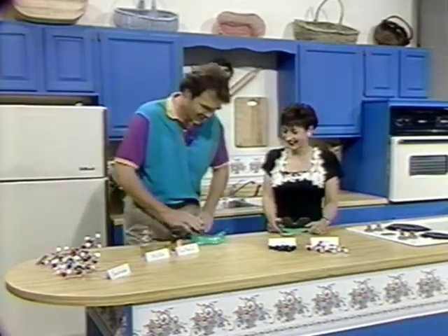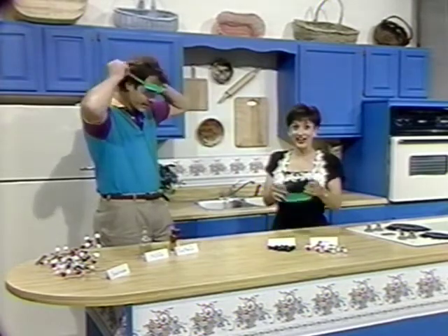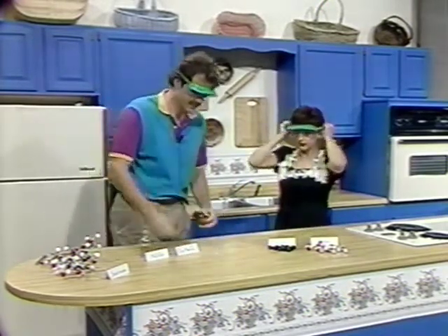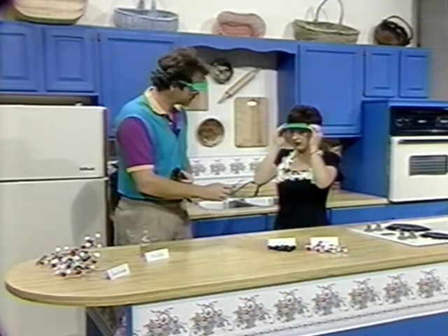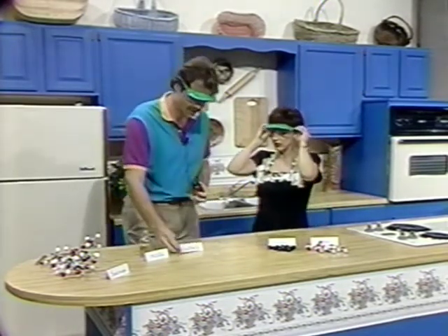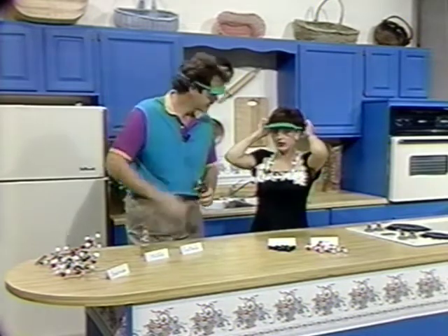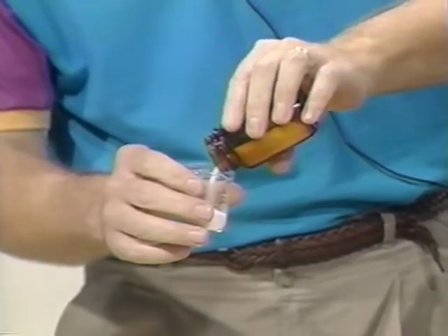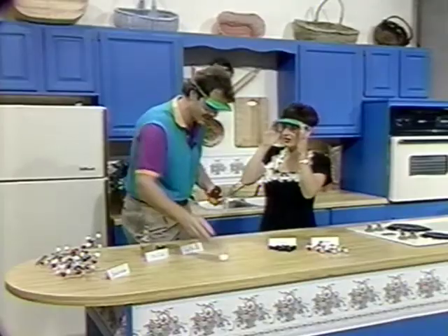All right. Now, we need to put our goggles on because we want to get a reaction started. Now, this is just table sugar, and its formula is C12H22O11. How do you keep these on? Slides down. Are you ready? Yeah, okay. Now, this is going to be kind of dangerous. No, this is not dangerous at all.